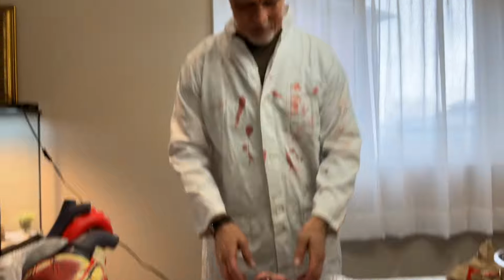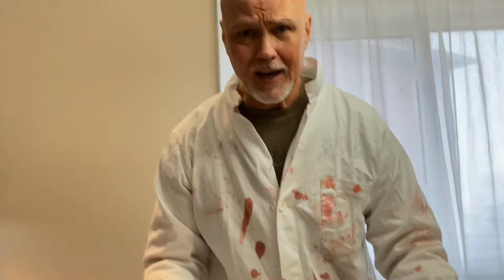Okay, so we got the heart out of the bag, and that did not go very well. How did I get pig's blood on my head? What is this, Carrie? Okay.